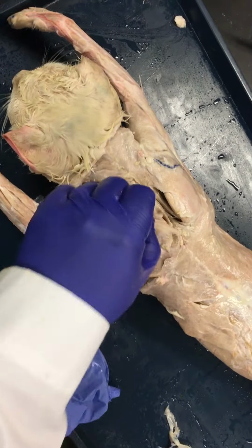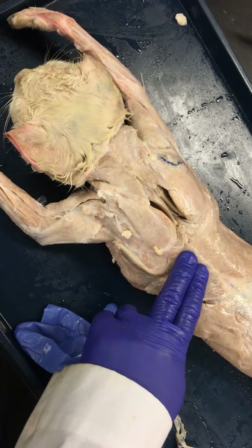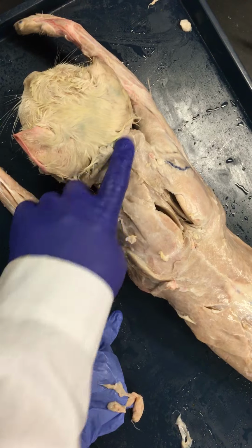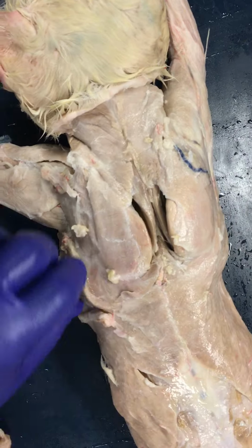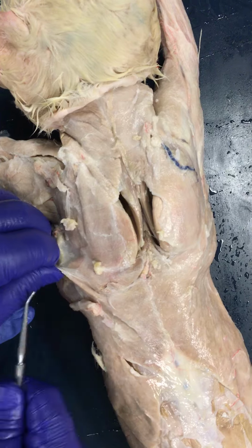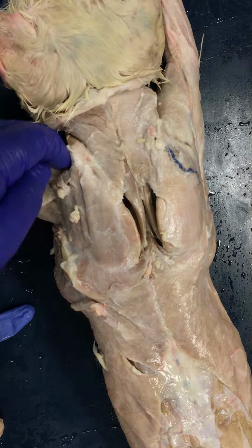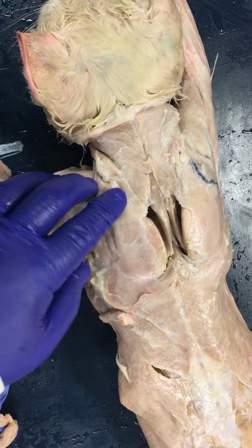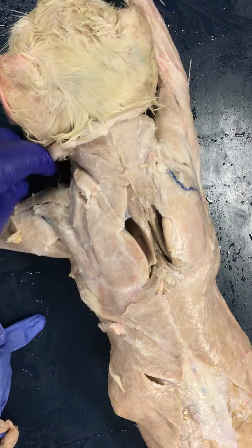So as you go up from there, you have your trapezius muscles, which remember in the cat there's three different ones, but in humans it would just be trapezius. But I do want you to know the cat ones here. So at the top you would have the clavotrapezius, the acromiotrapezius, and then the spinotrapezius. You can see there's separation there. As far as the action of the trapezius in humans, you're going to look at extension of the neck and elevation of the shoulders. Those are the main ones. You can also think of depressing the shoulders. So those are the main actions for that trapezius muscle.